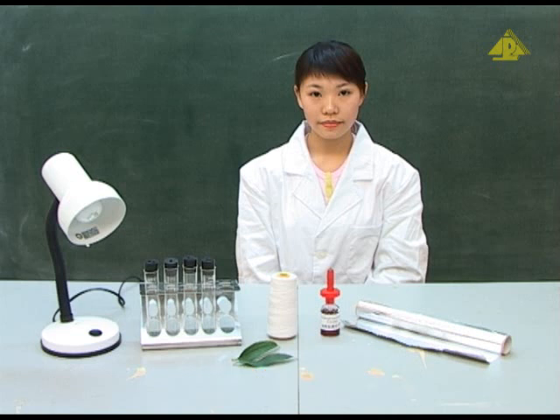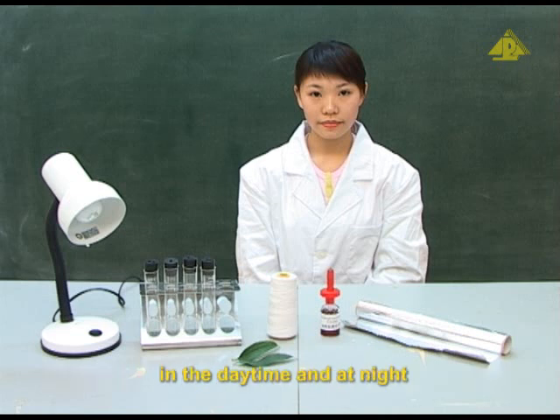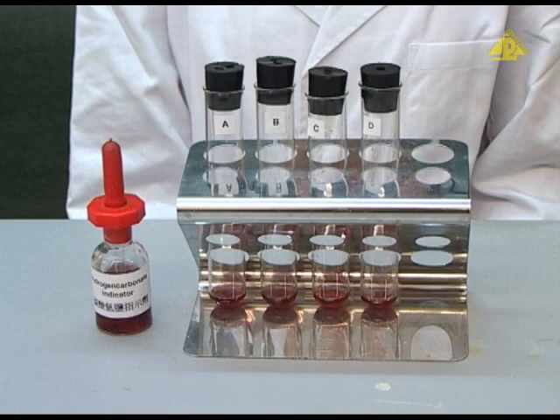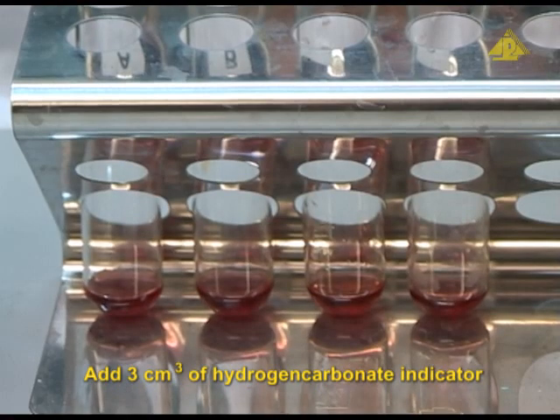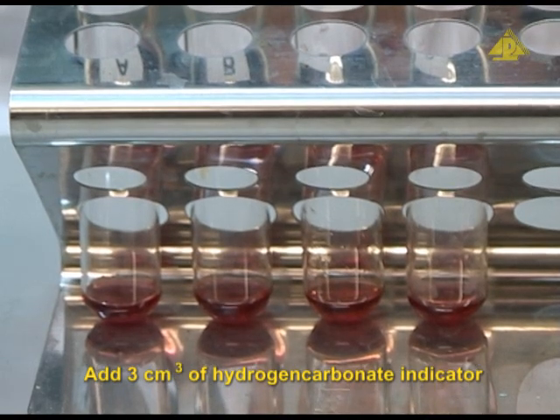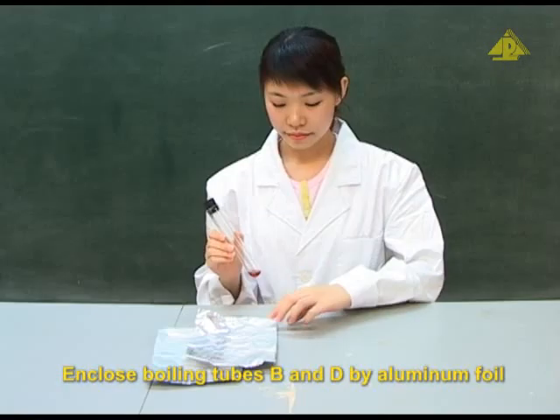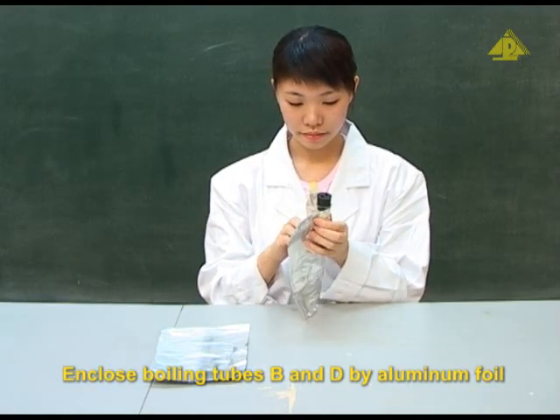In this experiment, we will study the gaseous exchange in green plants in the daytime and at night. Prepare 4 boiling tubes and label them as A, B, C and D respectively. Add 3 cm cube of hydrogen carbonate indicator to each boiling tube. Enclose boiling tubes B and D by aluminium foil.